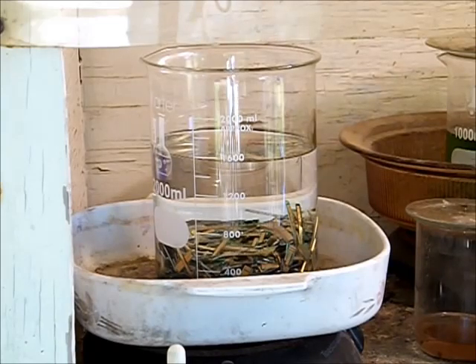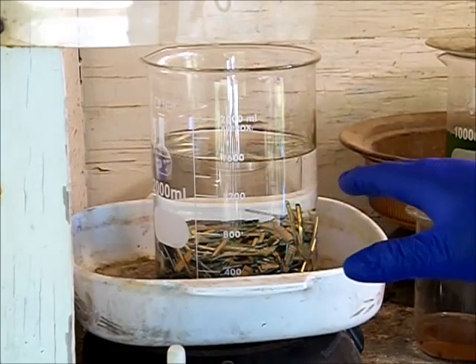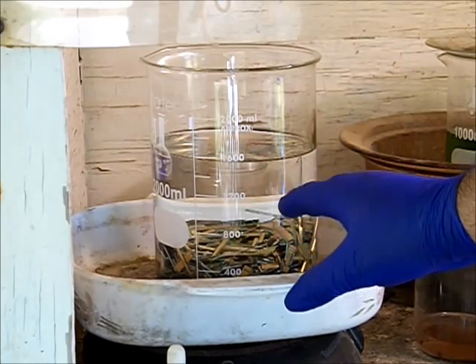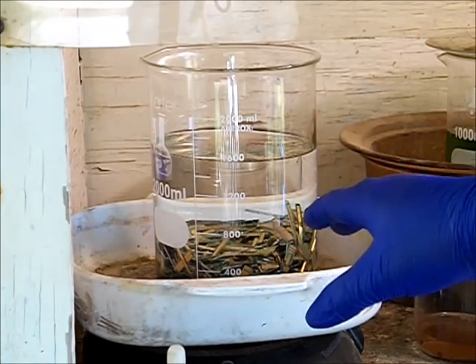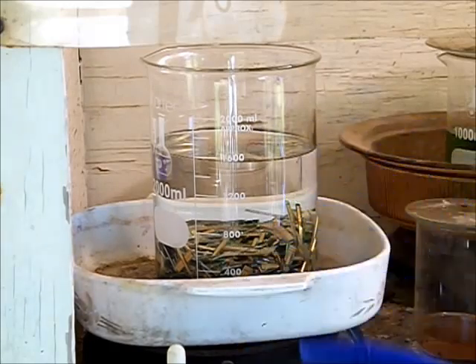After the amount of water is saturated with salt, no more dissolves. It doesn't matter if you add more acid, it doesn't matter if you add more nitrate. Once the volume of water is saturated with salt, it just stops dissolving.